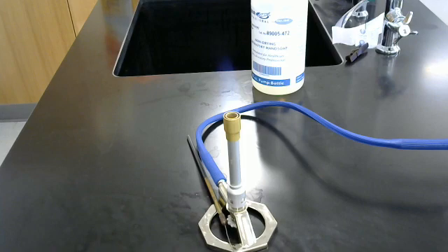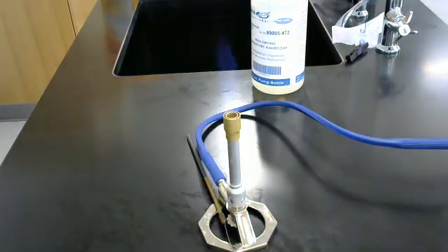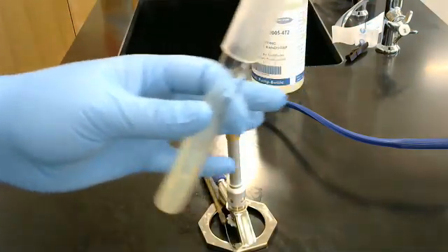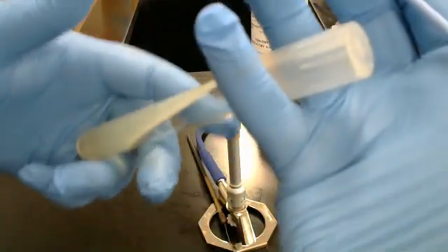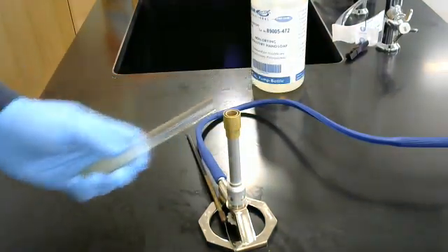For the disposable tools, like this one here. Same thing, but we don't sterilize the disposable tool. But we do still sterilize the tube. It is the same as before. Pop. One, two, three.